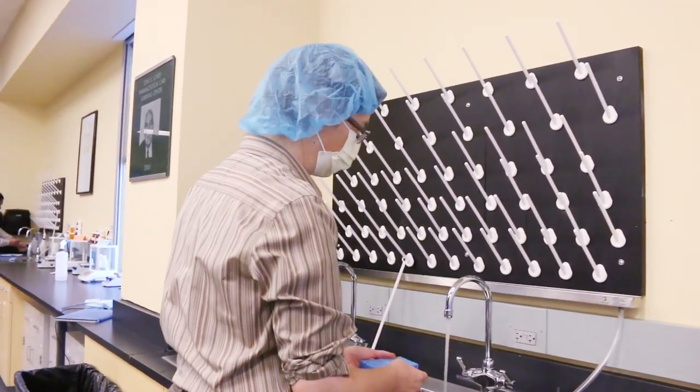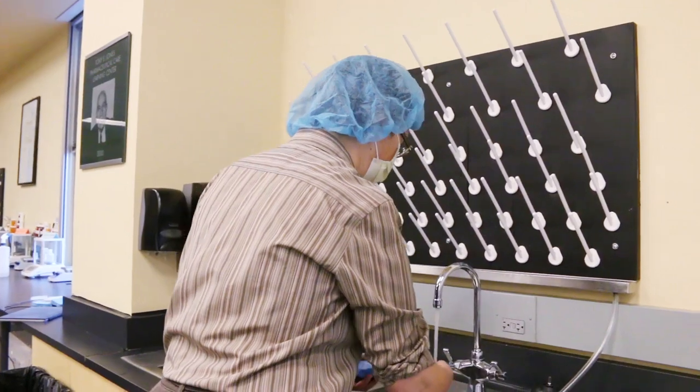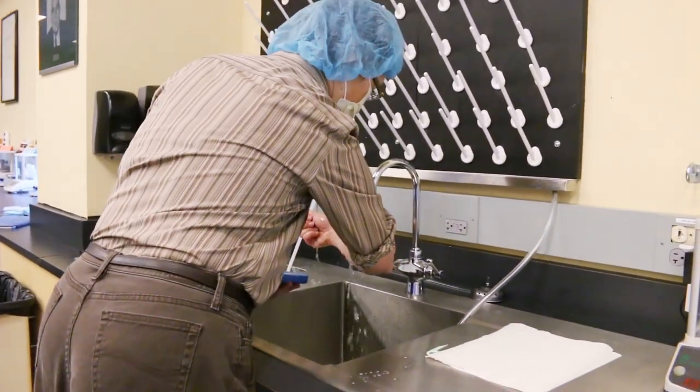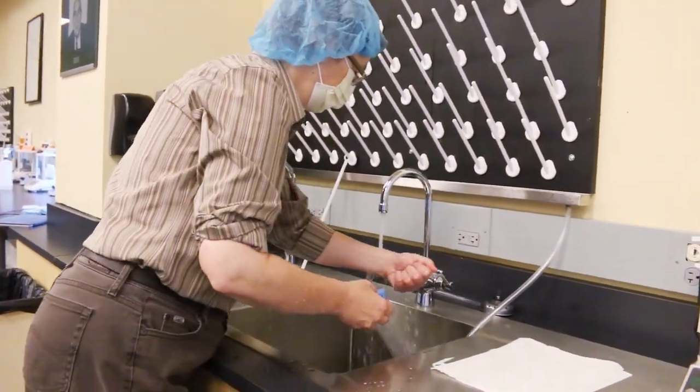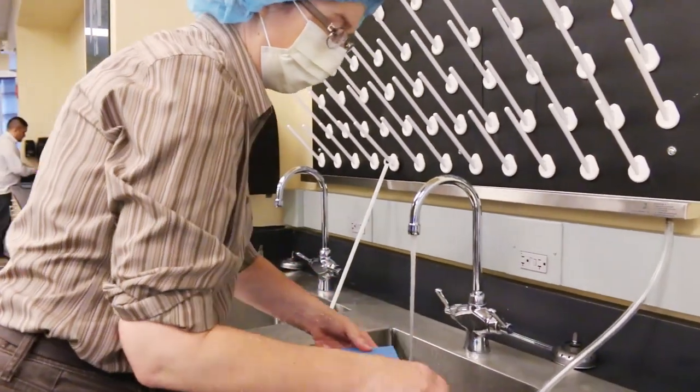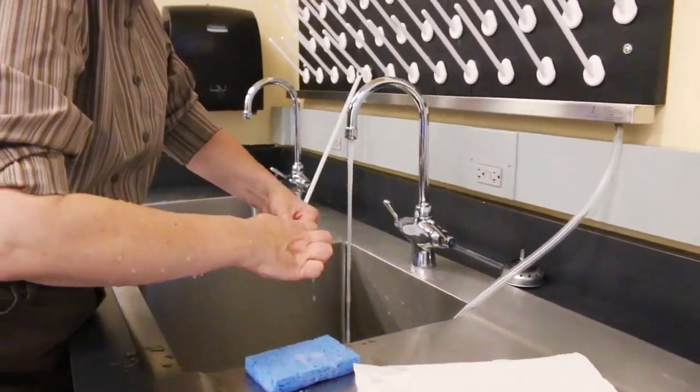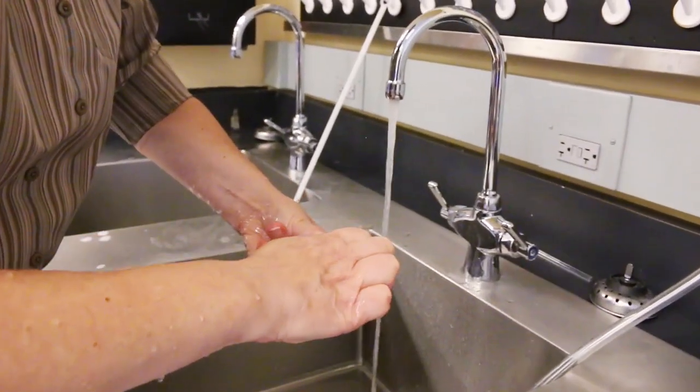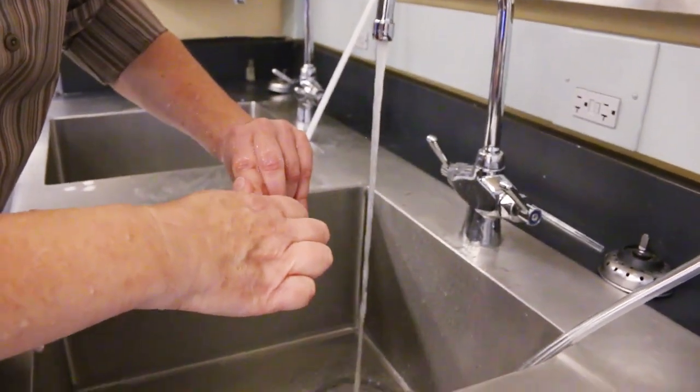9E, when the water is warm, wet your hands and your arms. Step 10, use the nail pick to clean under each fingernail. When you're completed with the nail pick, please dispose of that in the waste basket.